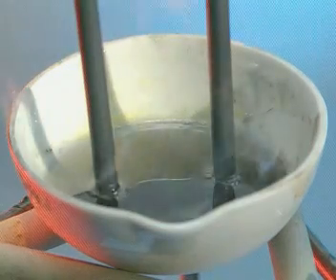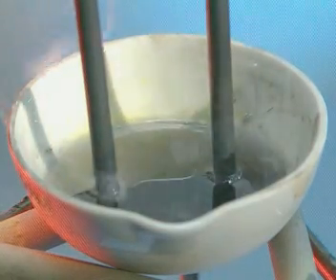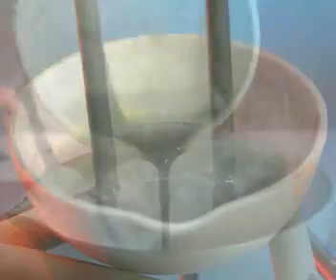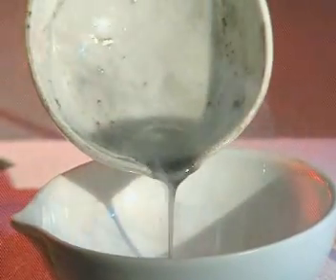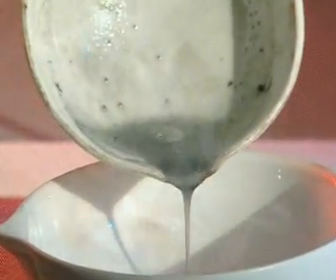Again, nothing appears to be happening at the negative electrode on the left. But pouring off the molten zinc chloride reveals a bead of pure zinc.